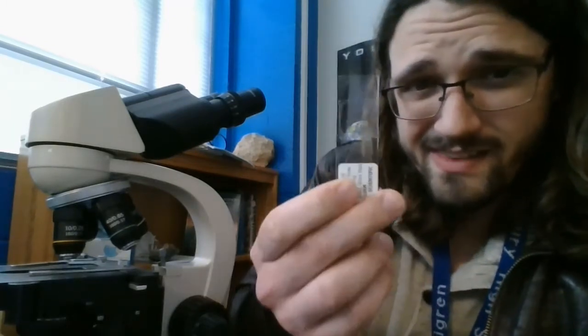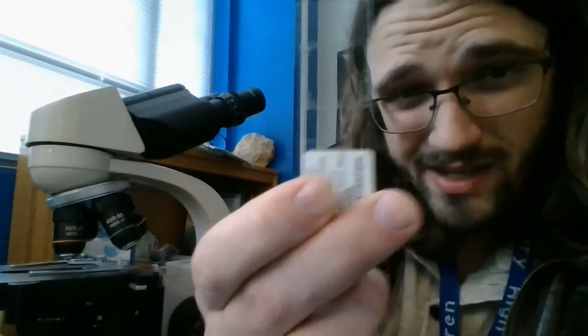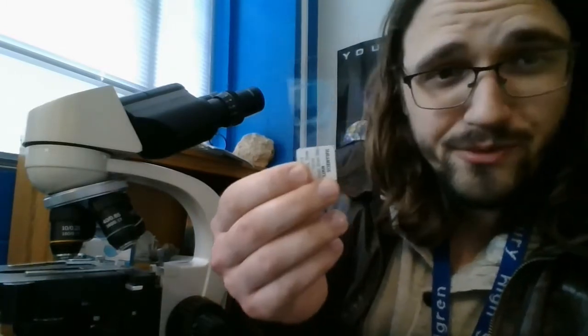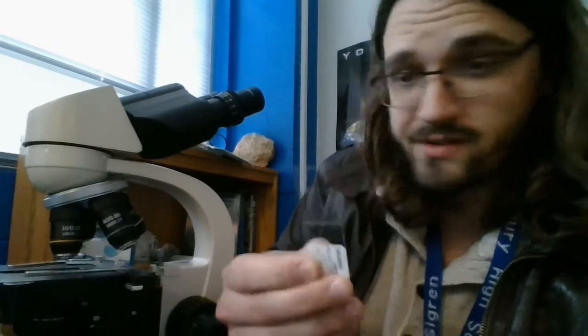So from that, we can see that there's a huge difference between 40x magnification and 400x magnification. And we can also get a perspective that these things are unbelievably tiny. I mean, this is the slide. Looking at them at normal magnification, 1x magnification of your normal eye, there's absolutely no hope of seeing those tiny little creatures.